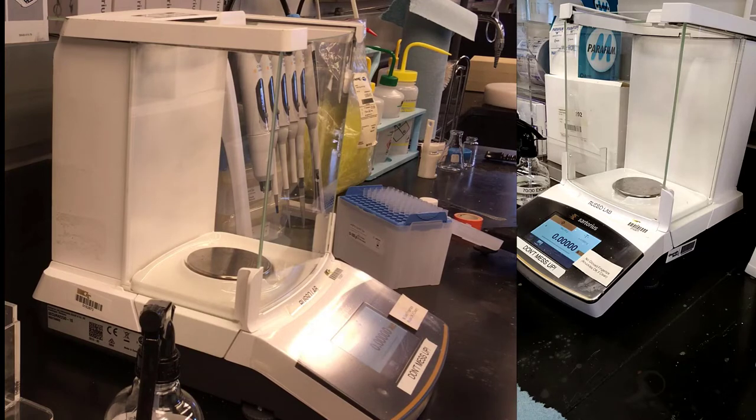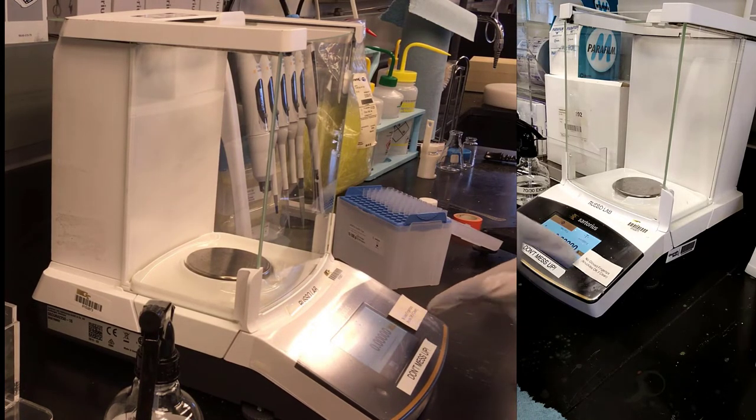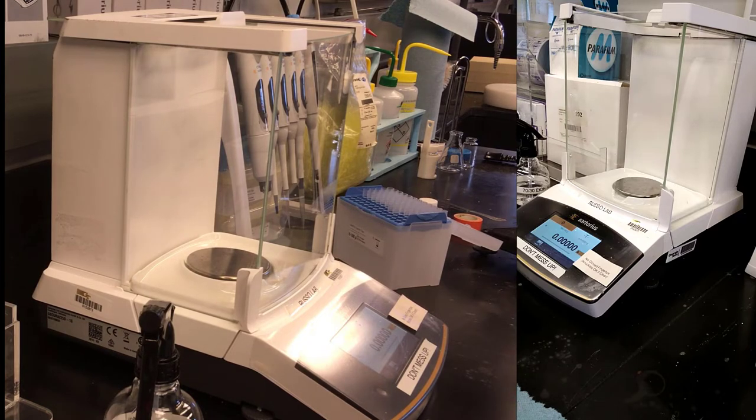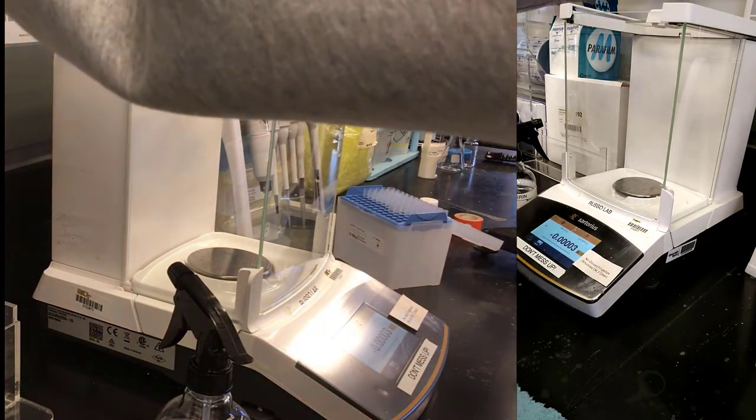In this case, the rule of the balance is no gloved fingertips. It is shown right here. No gloved fingertips. Knuckles are okay if they're clean. The knuckle of the glove is clean. Your hand knuckles are clean. I'm going to do kind of a hybrid. I'm going to wear one glove, and that means that the ungloved hand could have bacteria or something on it.